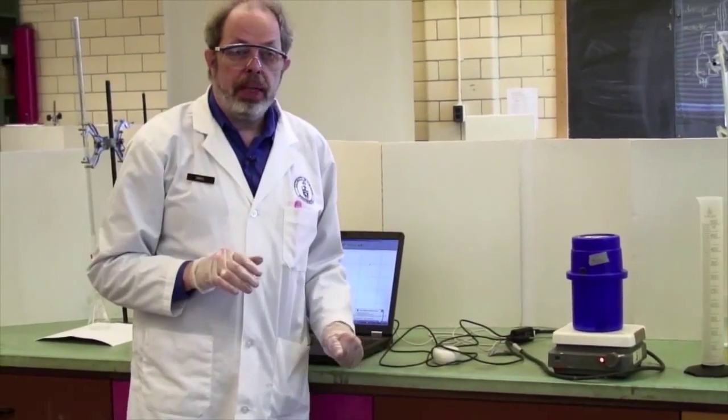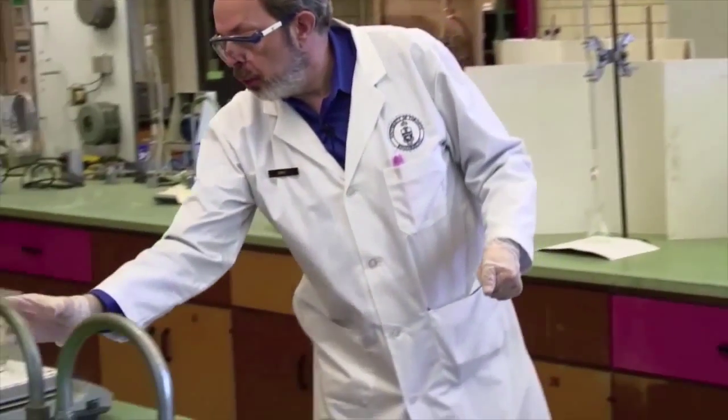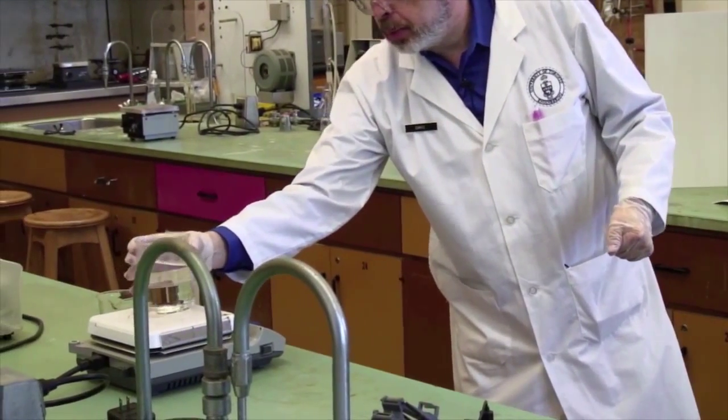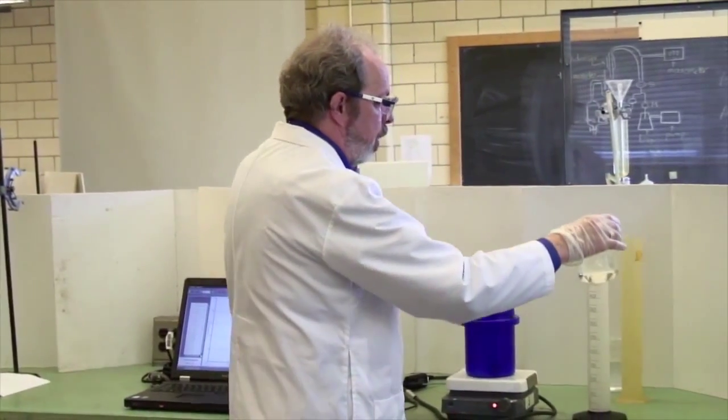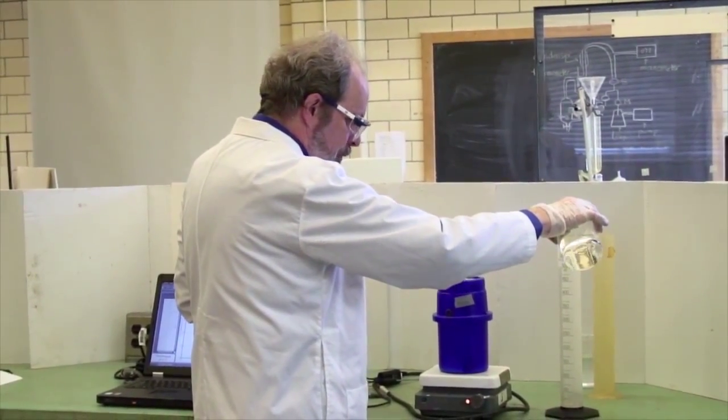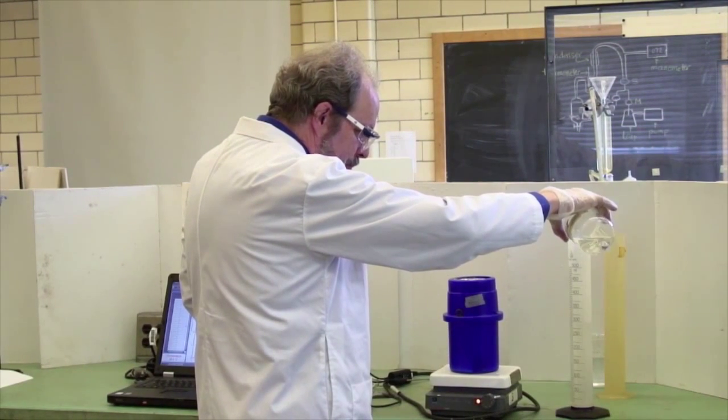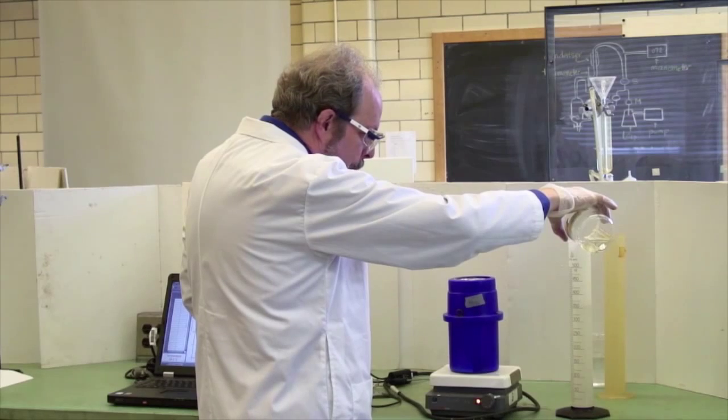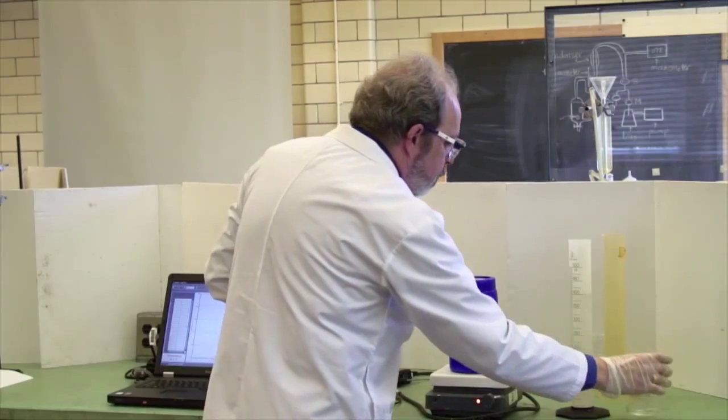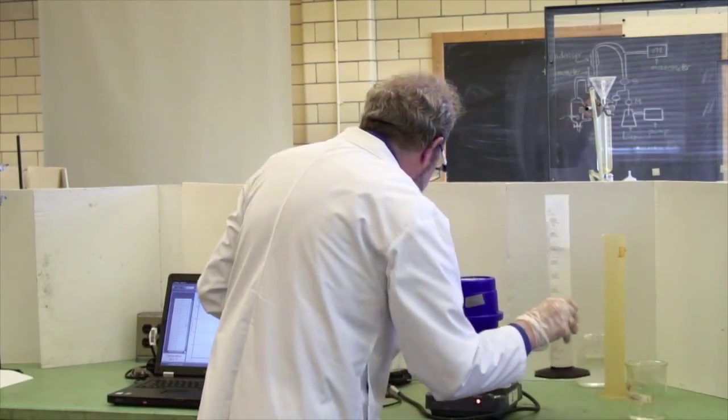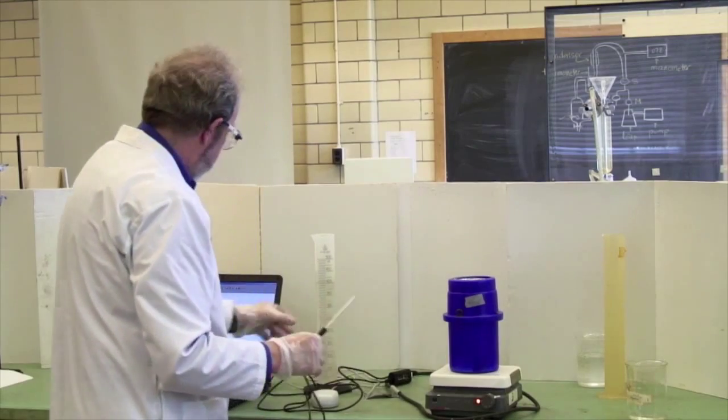We have hot plates around. And you should heat up some water to a reasonably high temperature. It doesn't need to be boiling hot. The temperature of a decent cup of coffee is good enough. And so I've heated this, or rather, one of my assistants has heated this. And measure out 400 mils of hot water.